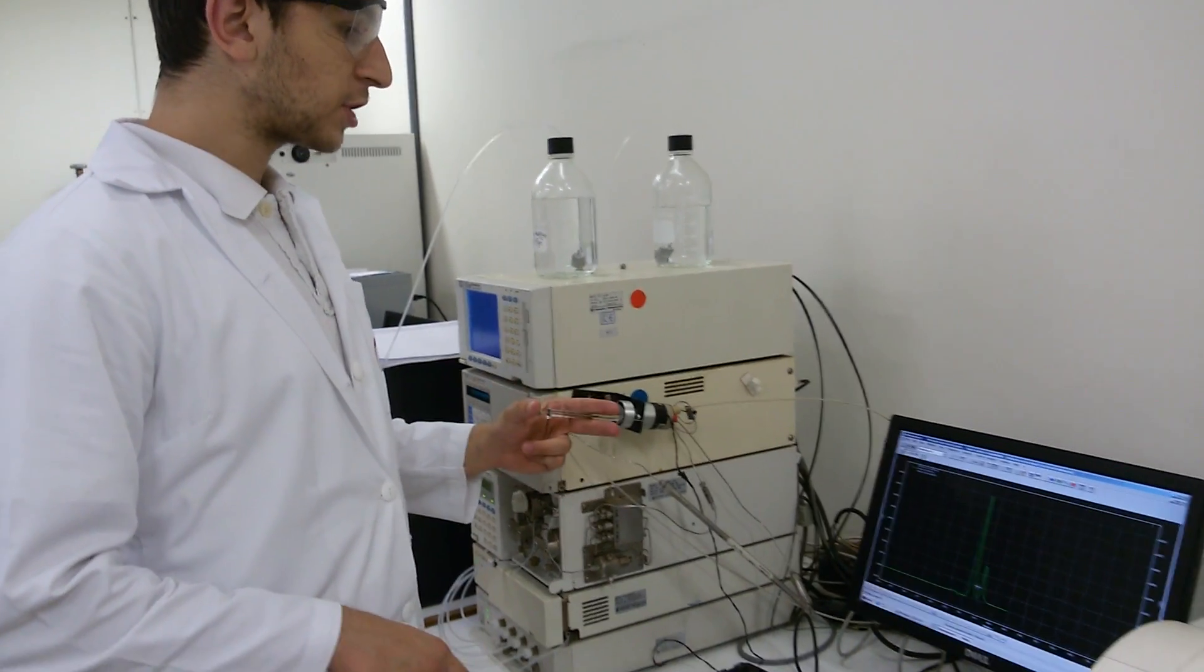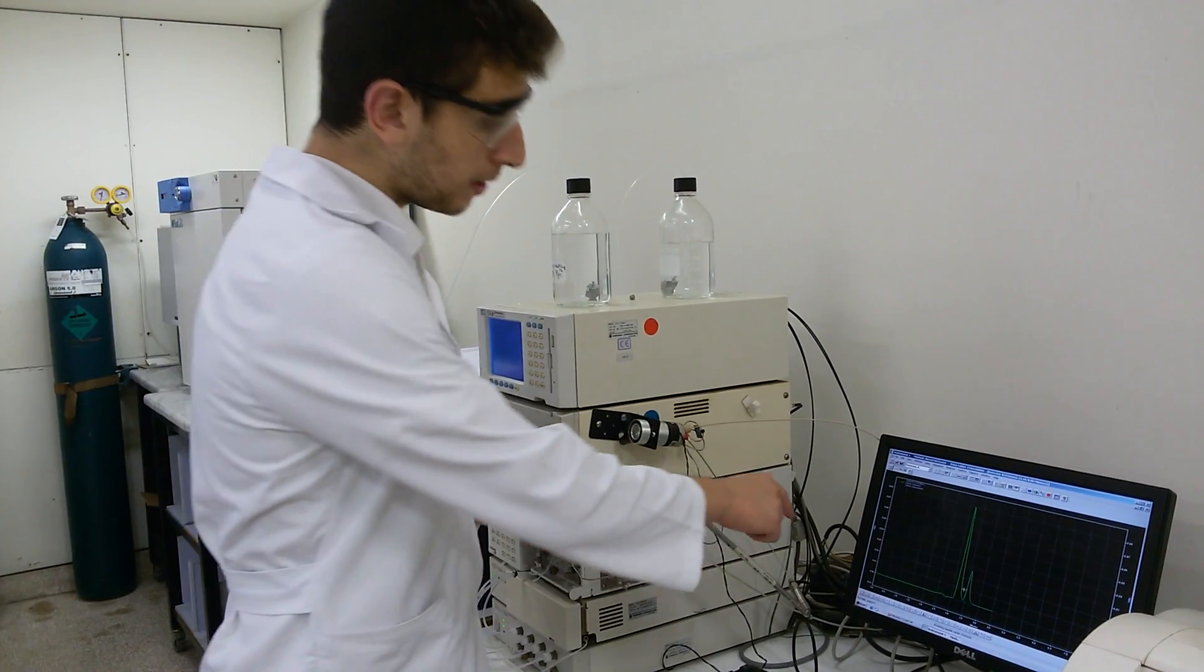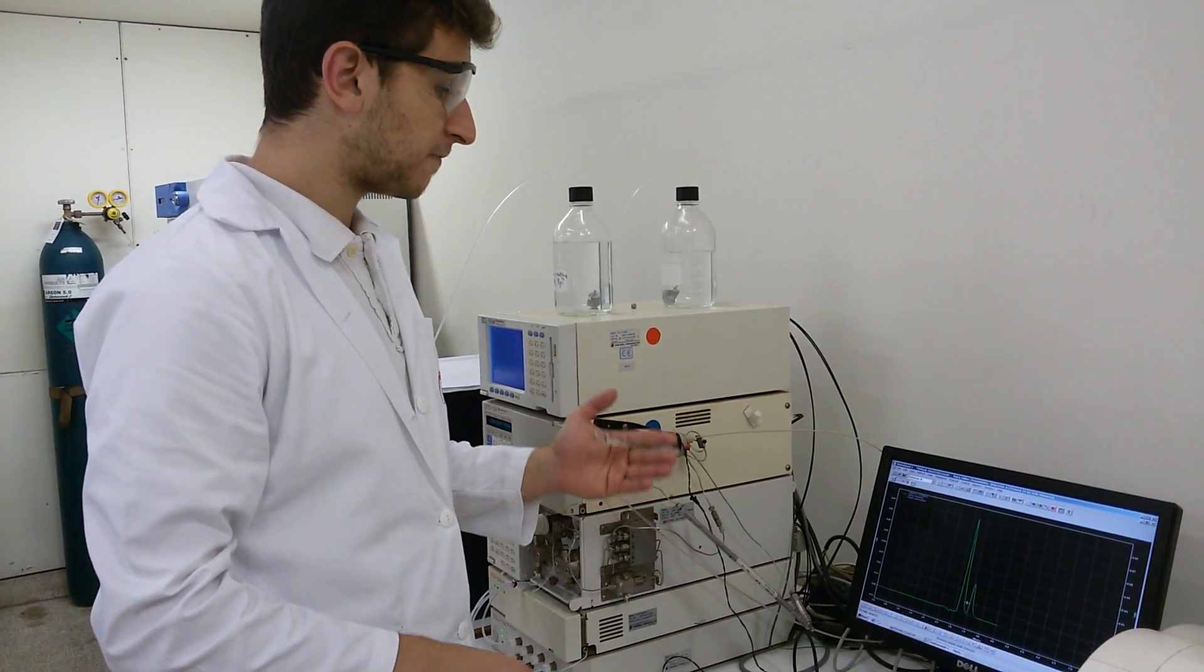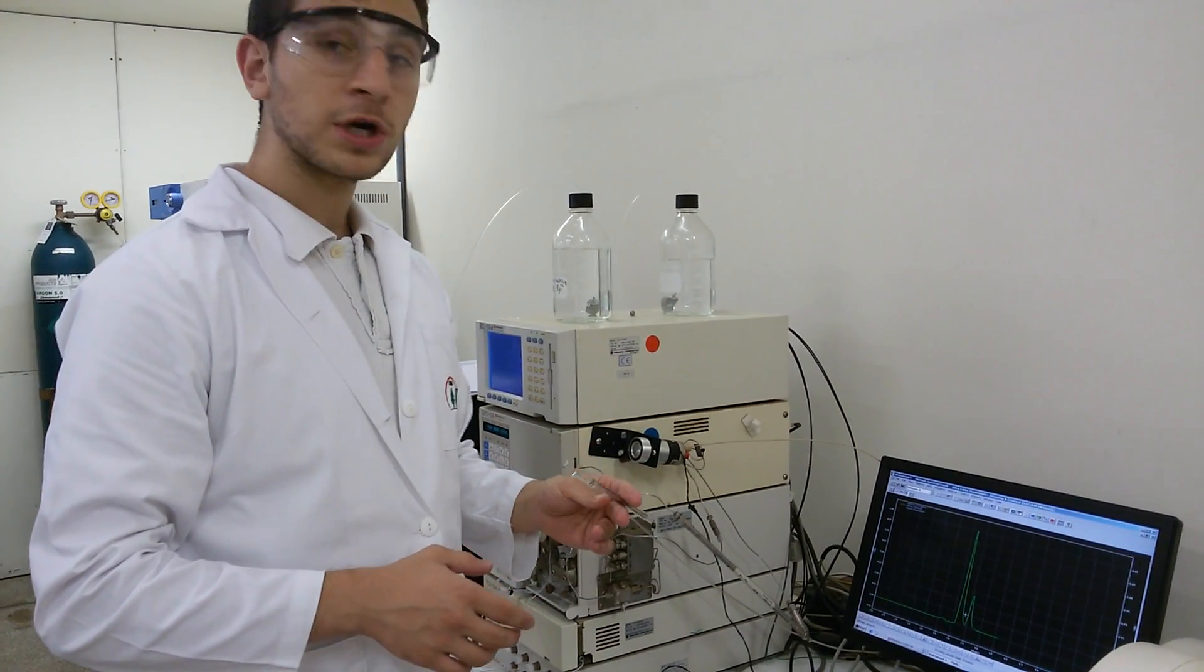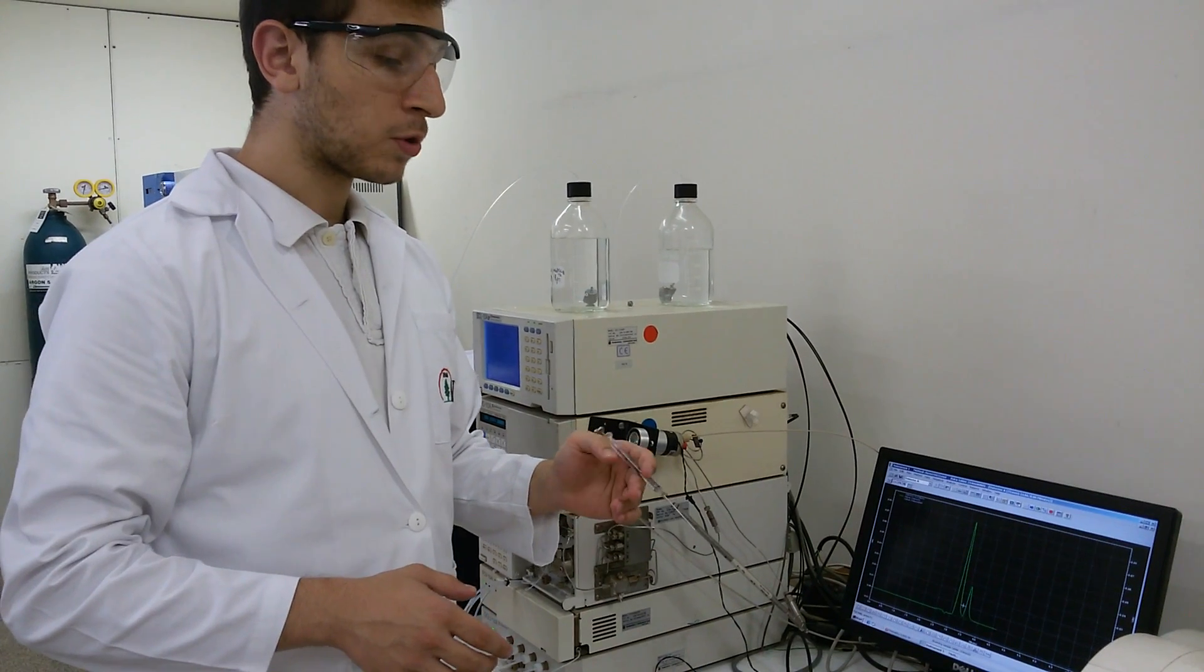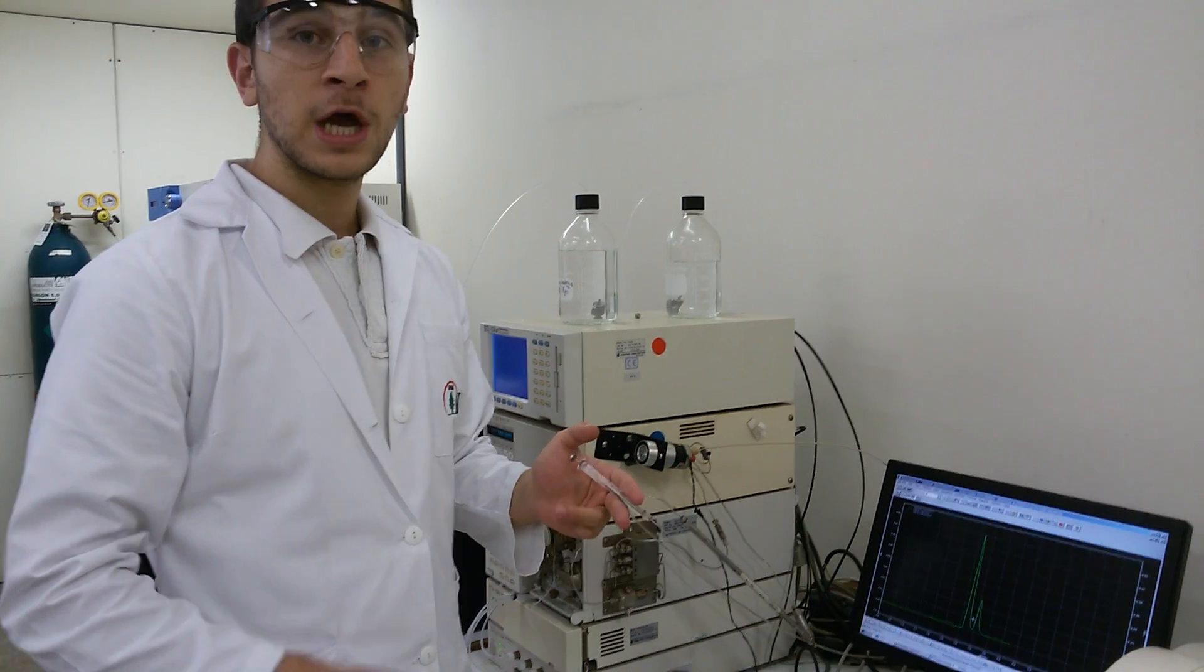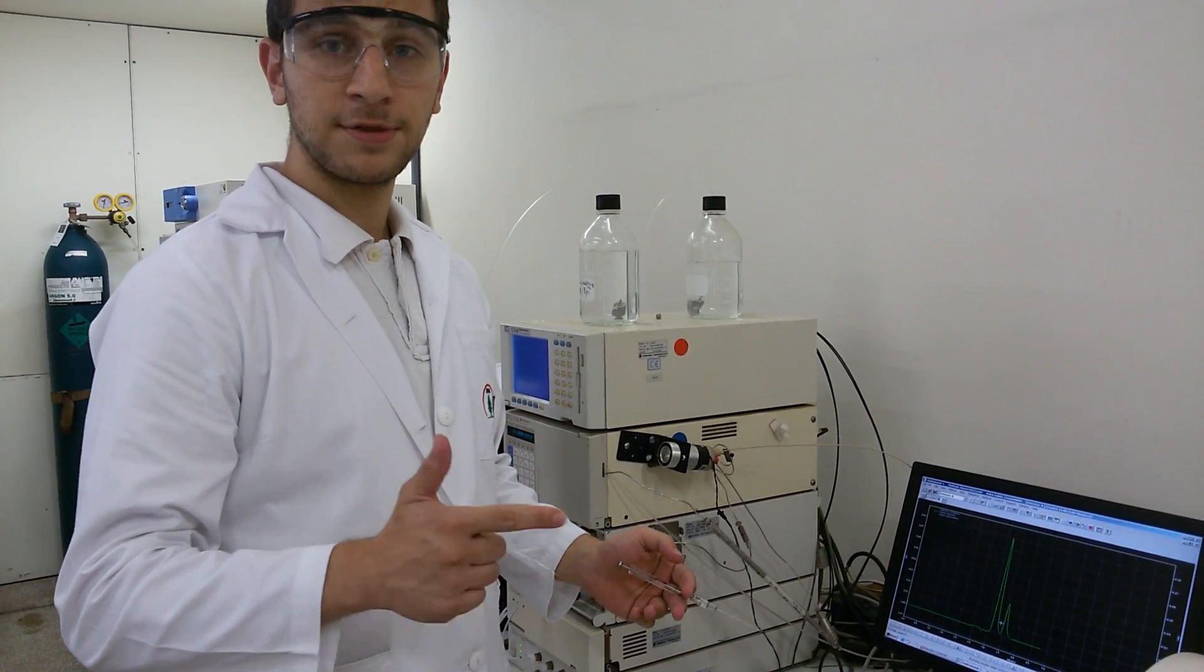After finishing the injection, a graph will appear on my screen. You can see here the peaks. It will take 8 minutes until the first injection will finish. After 8 minutes, I need to start my second injection which is also standard one but at another wavelength which is at 225 nanometers. I will do the same thing for standard 2 and 3 and for my tablet sample.